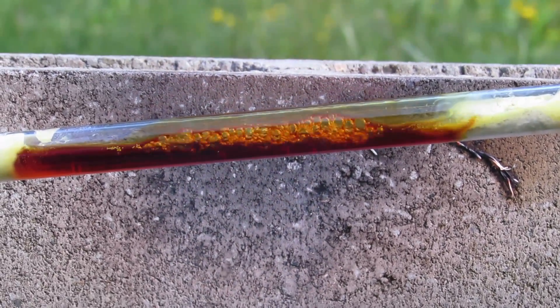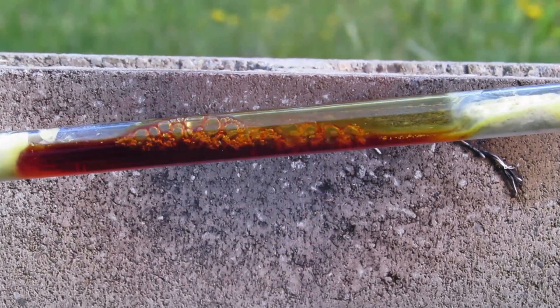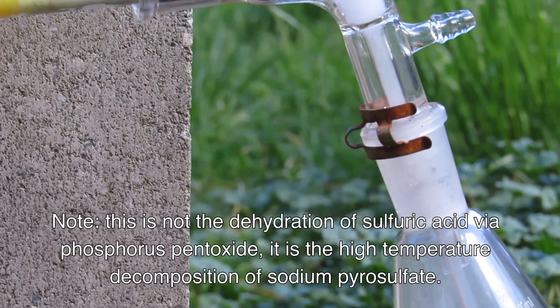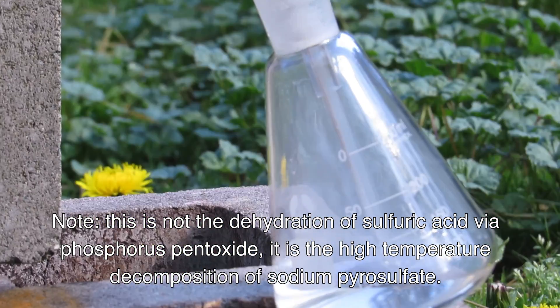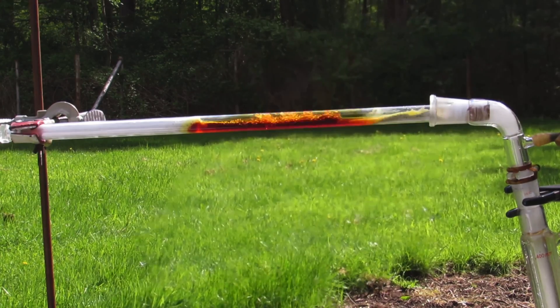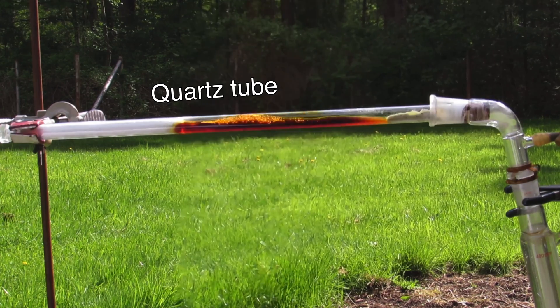As a short backstory, I have tried synthesizing sulfur trioxide several times with varying results. It is most commonly produced in the lab through the dehydration of sulfuric acid by phosphorus pentoxide. However, phosphorus pentoxide is challenging to obtain from wholesome materials, and first requires synthesizing and then burning white phosphorus. There are much more easily obtainable chemicals such as anhydrous copper sulfate and sodium pyrosulfate, which will decompose to sulfur trioxide. However, the decomposition does not occur until quite high temperatures, which are too high for ordinary borosilicate glassware, so quartz glassware is necessary.